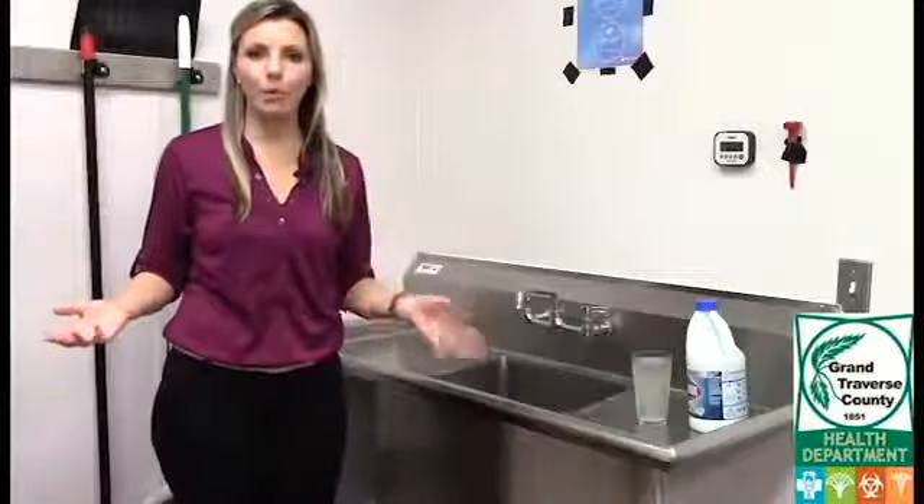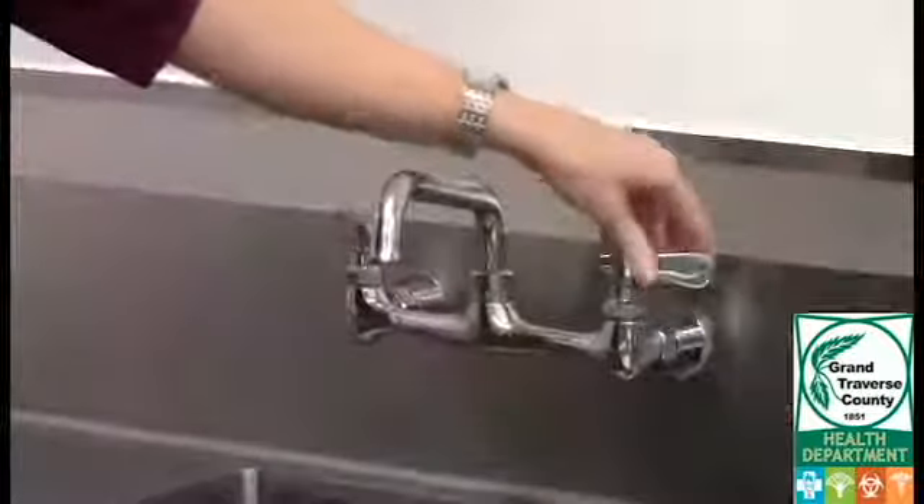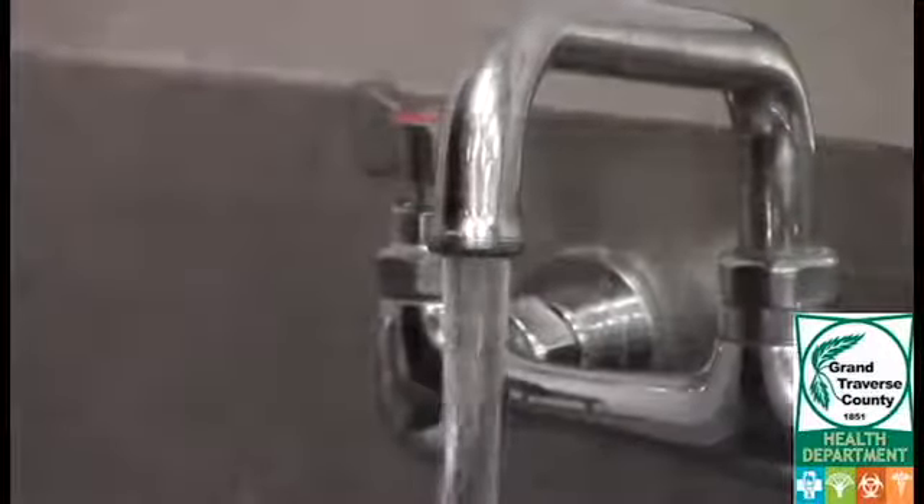This is a great time to get the paperwork done that's going to be sent into the lab. Once you've filled out the paperwork and the bleach has sat on the faucet and disinfected it for about five minutes, you're going to want to run the water for about five minutes — and remember to use cold water, not hot.